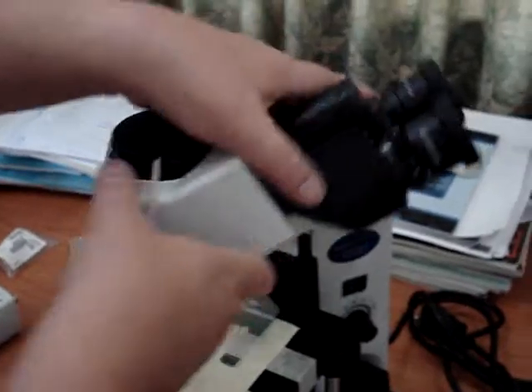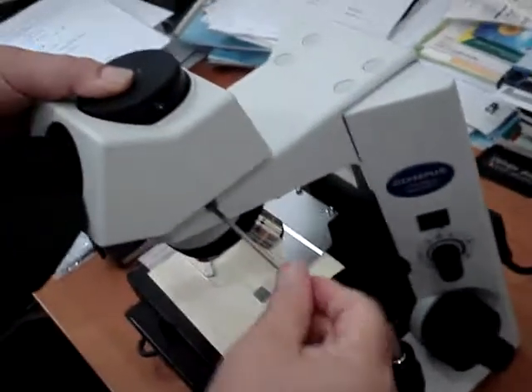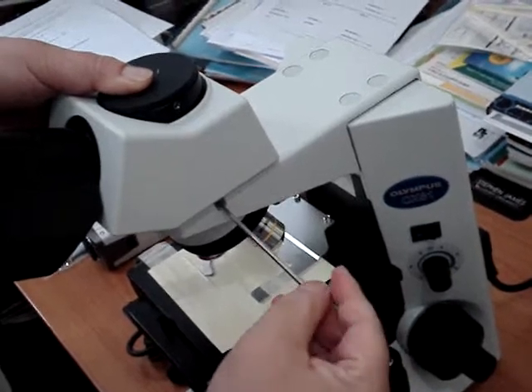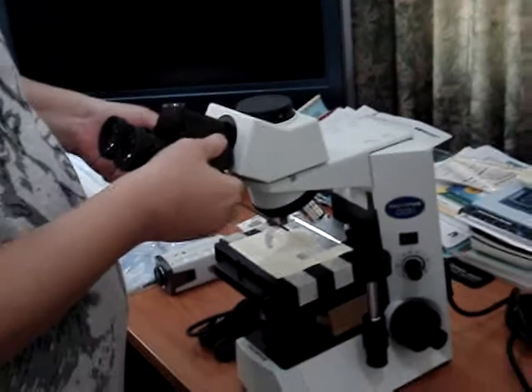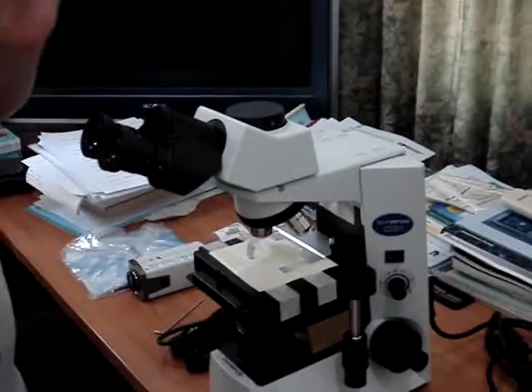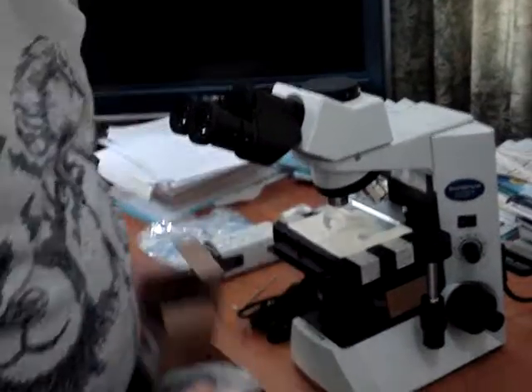Turn it to the right position. Hold it, fit it. Check it again and assemble it. See now — from two pieces, do one piece.